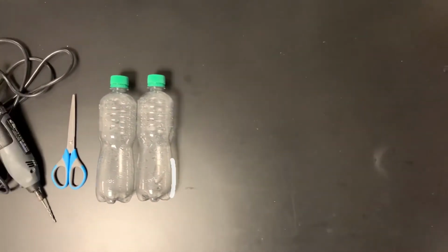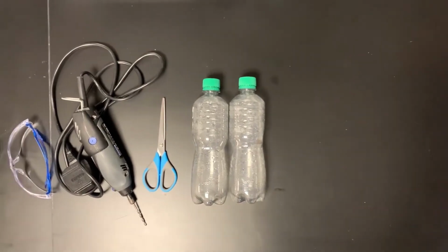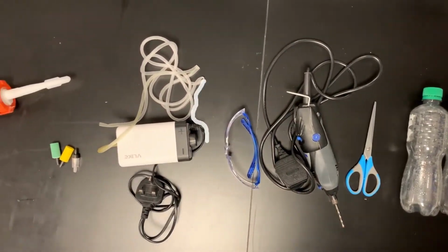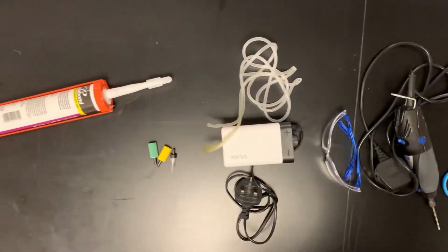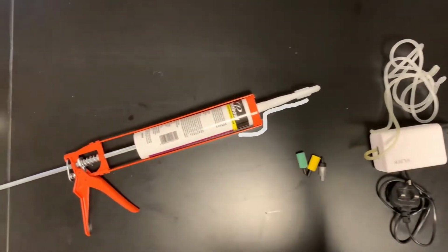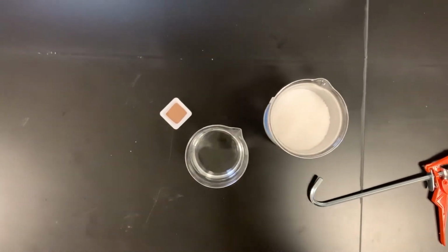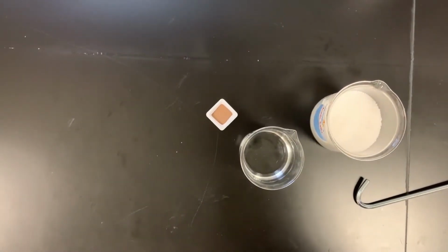Now that we've shown you what the brine shrimp hatchery looks like in our lab, we're going to show you how you can make one of your own at home. To do that, you're going to gather a few things first. You are going to need 2 bottles, a pair of scissors, a drill or a Dremel, a pair of safety glasses, an air pump, a valve, an air stone, some silicone, and salt, water, and brine shrimp eggs.